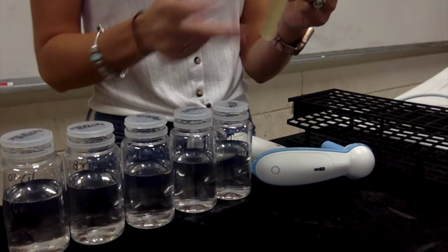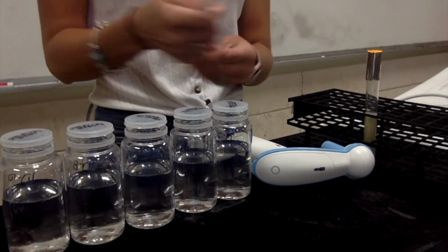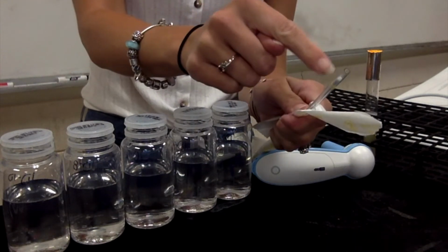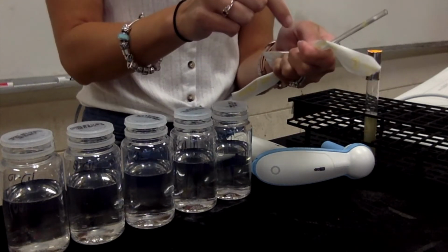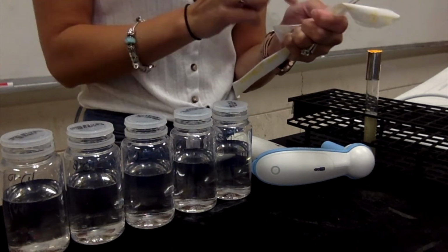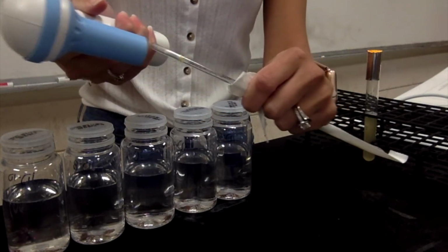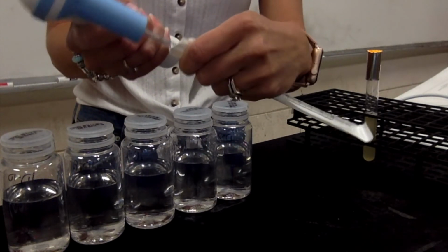All right, so I've got my E. coli nice and mixed. So the way that I like to open these pipettes is just tear the paper, making sure that I have the cotton tip, okay? And you don't want to touch this part, okay? Remember, aseptic technique. You do not want to touch the pipette itself. If you do that, then it's not sterile anymore. So you're going to insert the cotton part into the automatic pipetter, and you're creating a vacuum, so you want to push it kind of hard.